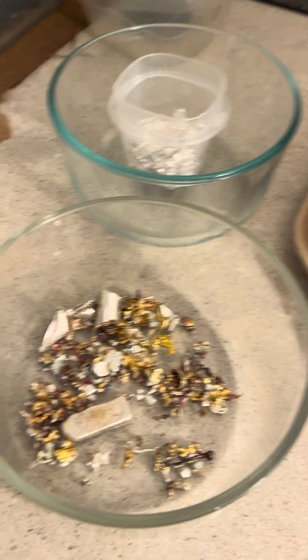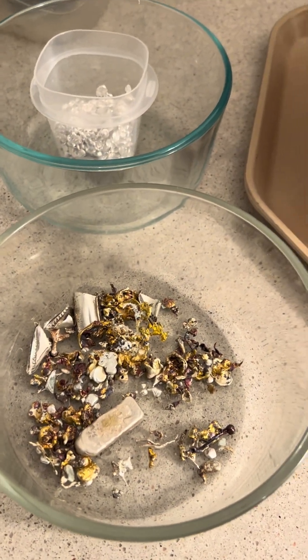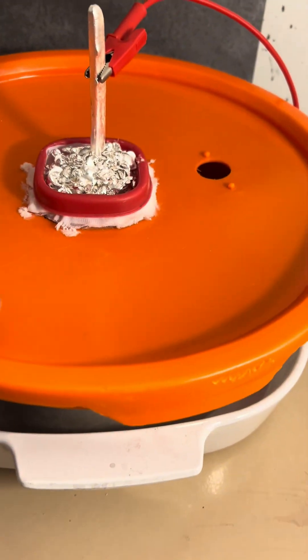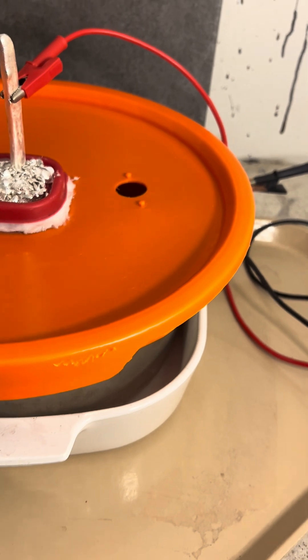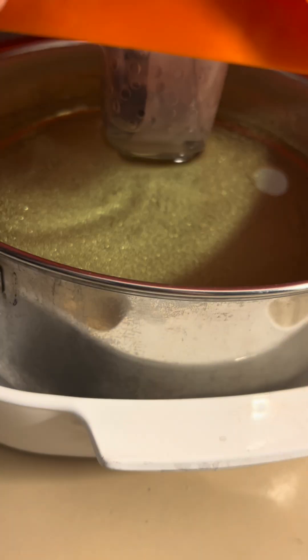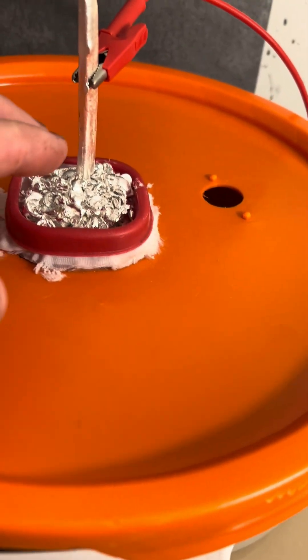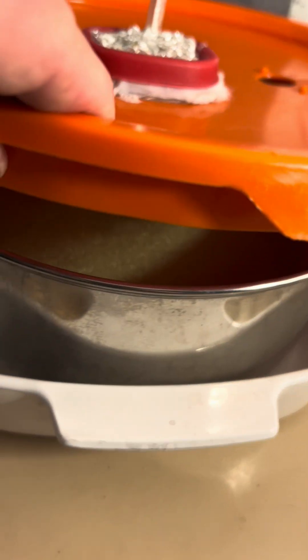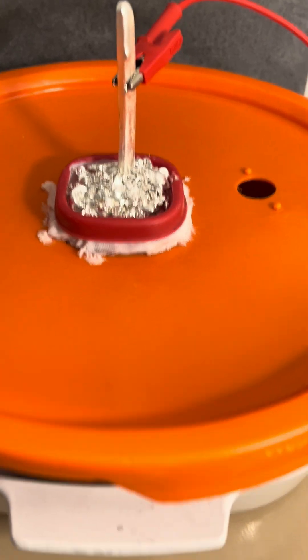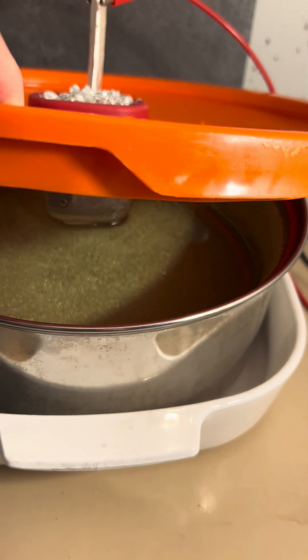So I'm torn — do I mix that up or do I run it through a smaller cell as a dirty cell later? But this is growing silver at home, silver cell day one. Right now I'm running at half a volt and 0.73 amps, running just a little lower. I want to keep the platinum and stuff in the basket and we'll just see how the growth is. I'm not in a rush, but I am running out of silver rather quickly. This is a six liter stainless steel pot that I picked up at Goodwill. But that's it — growing silver at home.